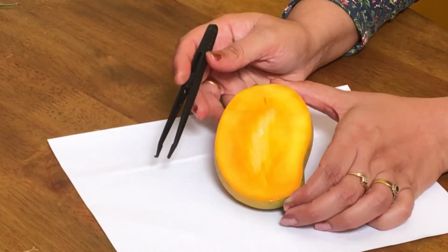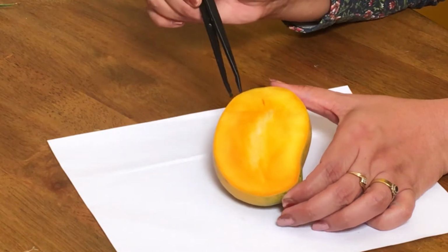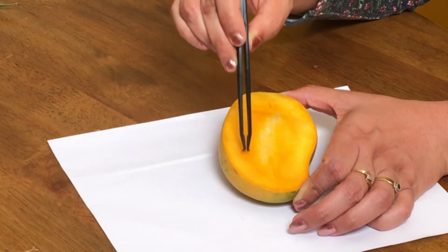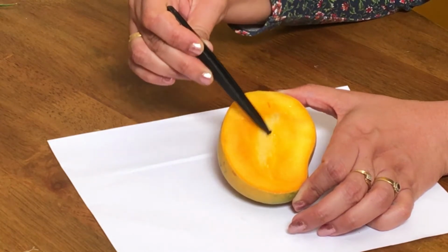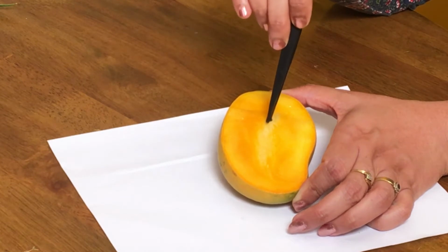Mango is a simple fruit. This is the pericarp of a mango, which is divided into the outer peel, which is the epicarp, the middle fleshy mesocarp, and this fibrous area, which is the endocarp. And there will be a seed inside once you cut it open.